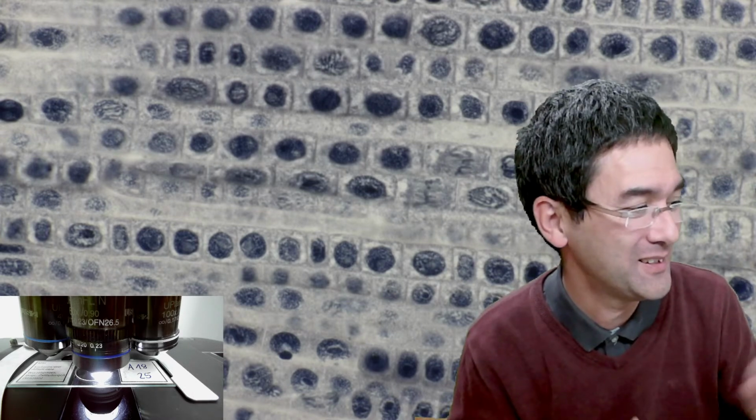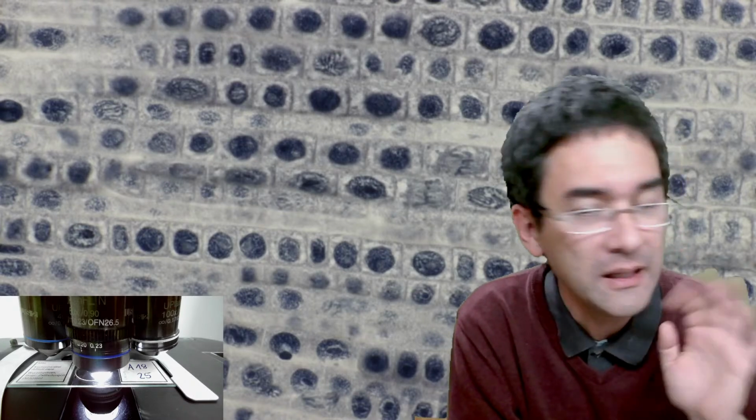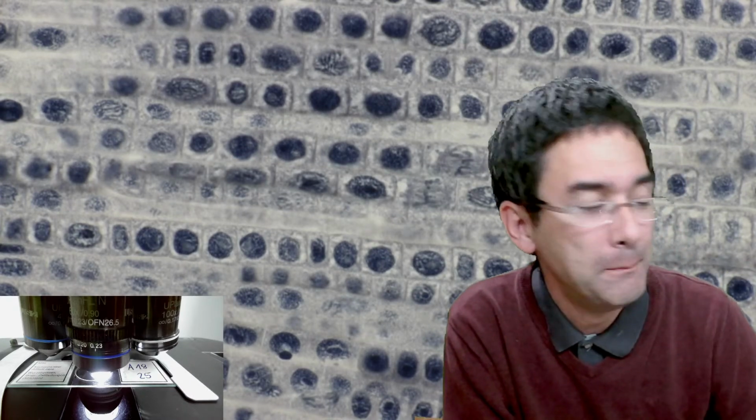There's a question: is that a correction collar or color? No, collar, just like the collar of a shirt. Like the shirt collar goes around the neck, that's why they call it a correction collar, or correction ring. It is also sometimes referred to as that. This is found in some better objectives. I don't think the correction collar makes a huge difference now, but it's a nice feature to have, and not all companies make those. It's only used for the higher aperture microscope objectives.